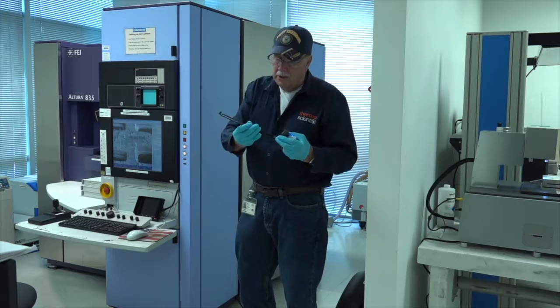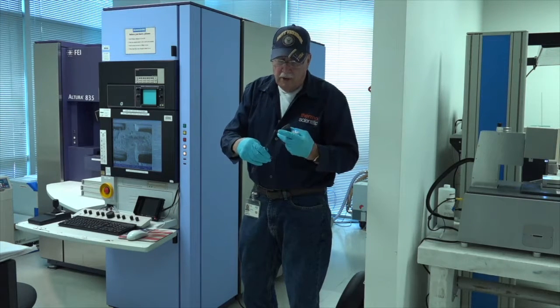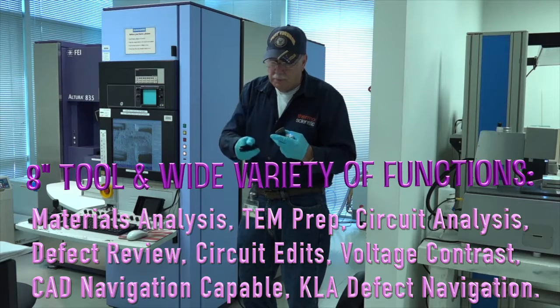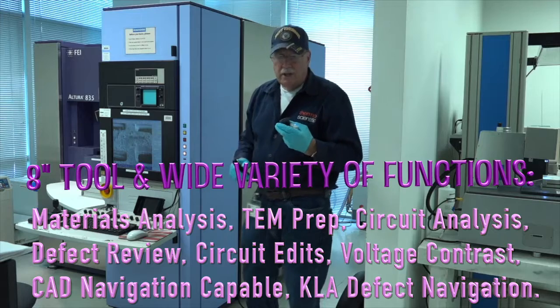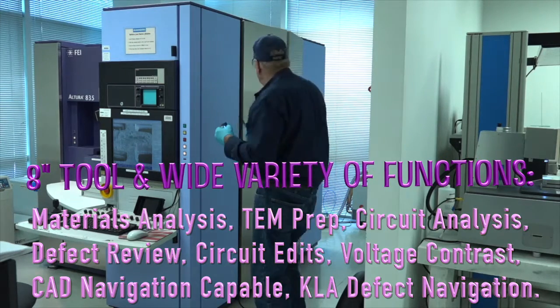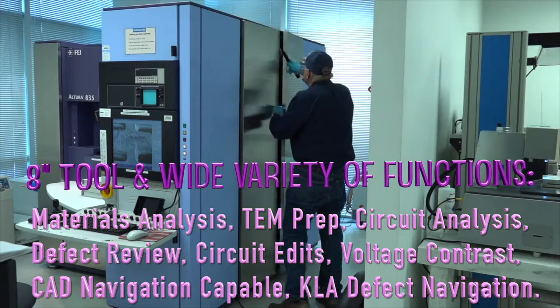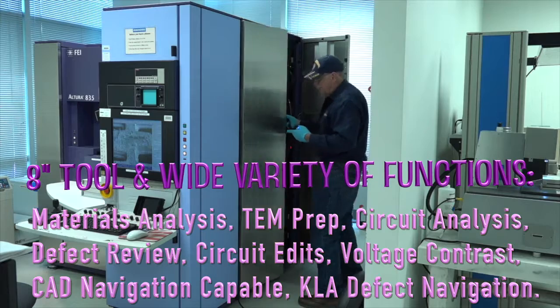Open them up with a little tool that looks like this, and it's got a little finger on it. We slide it between the doors and pull down the tab that's on the inside. I think it's kind of neat. It doesn't show the hardware on the outside. It makes for a nice clean package. So the tab is right here. We pull that down, you can open it up just like that.